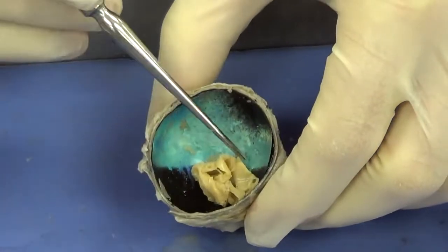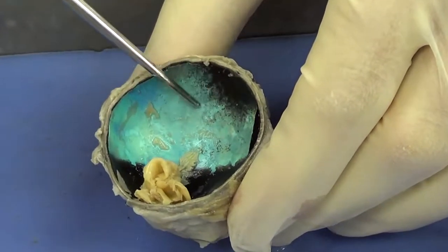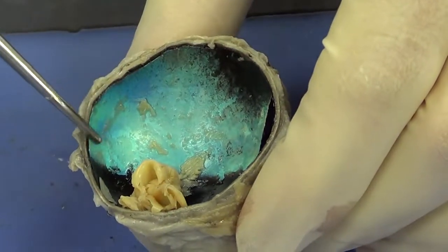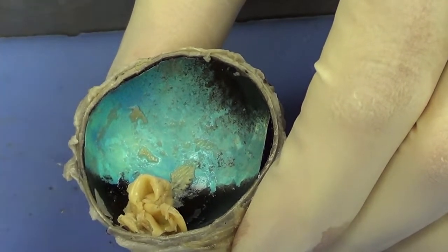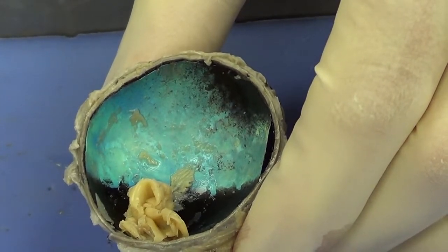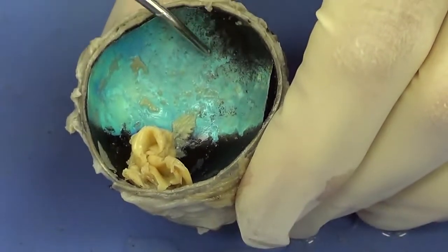Now going back to the eye again, that's the retina. The next part that we come upon is going to be this iridescent, metallic looking structure here. Now humans don't have this, but animals that are nocturnal, that are active at night, or animals that are crepuscular, active during twilight, early morning, late evening, it actually helps them see better at night.